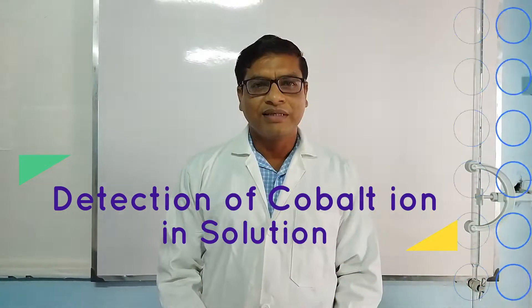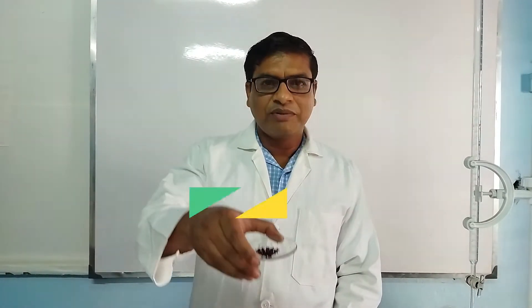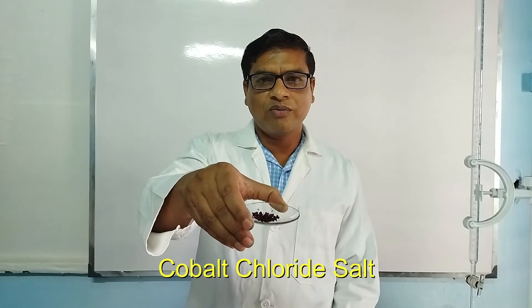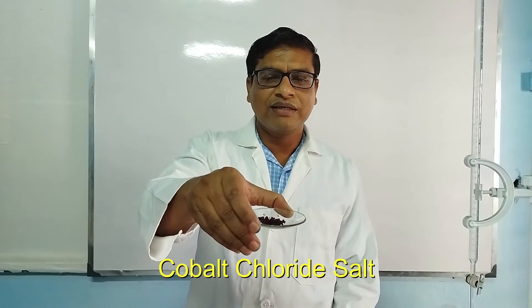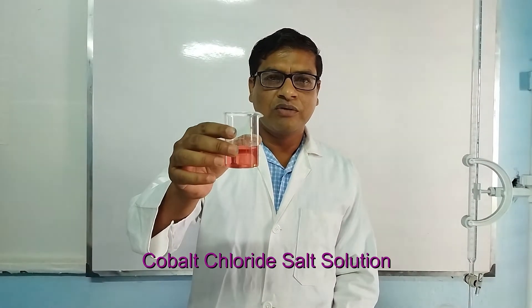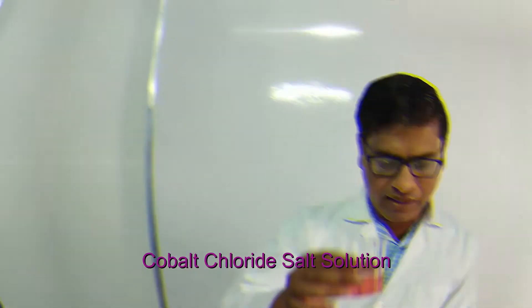Hello friends, today I am going to show you how we can detect cobalt in a solution. For this purpose, I am taking cobalt chloride as a salt. First, we prepare a solution of cobalt salt using distilled water.